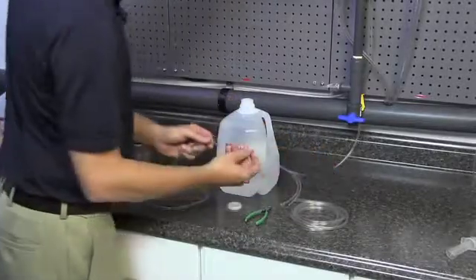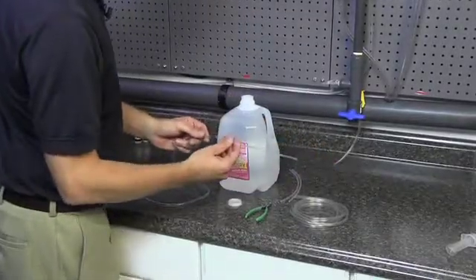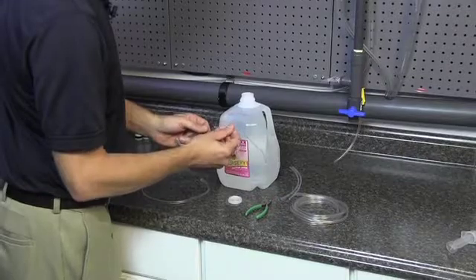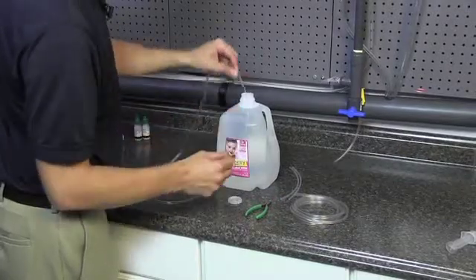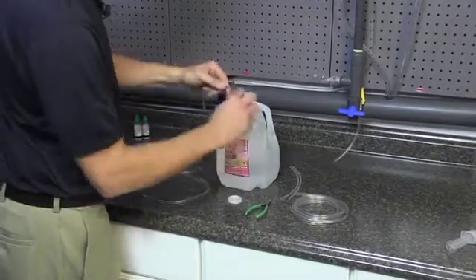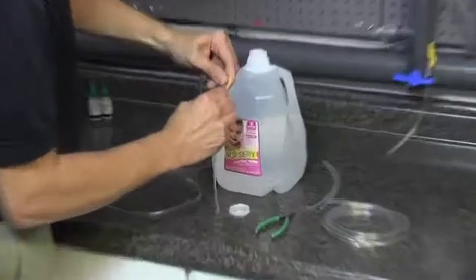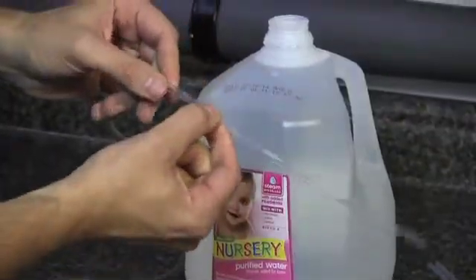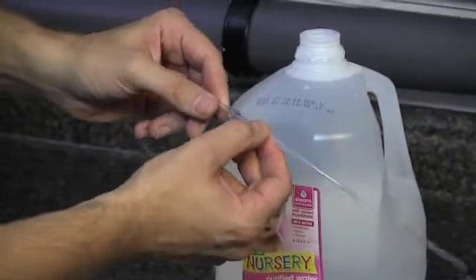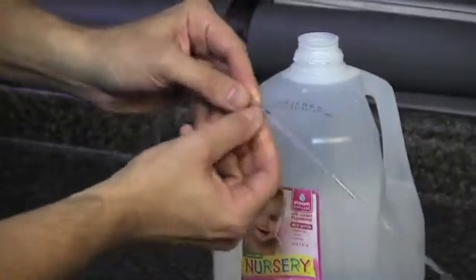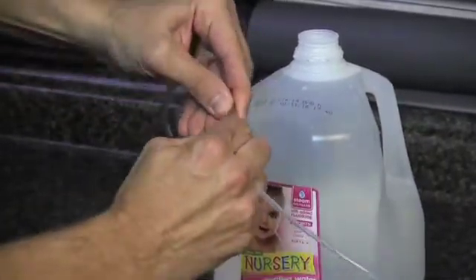The next piece of tubing we're using here is a shorter piece of Teflon tubing. This is more rigid tubing. We use this so that it doesn't, when we put it in the jug, it won't coil up on us. So just simply insert that tubing. Now this is three thirty-seconds OD tubing and it's going into an eighth inch ID tubing, so it's a pretty good snug fit.